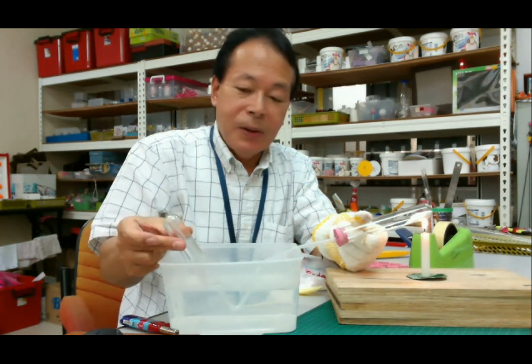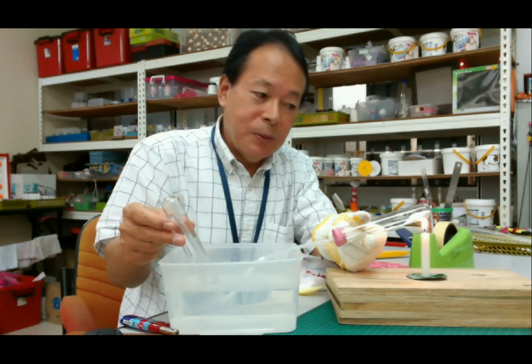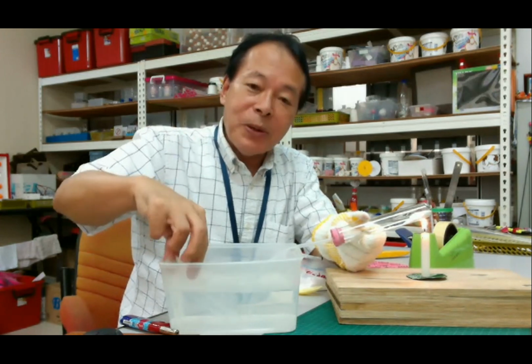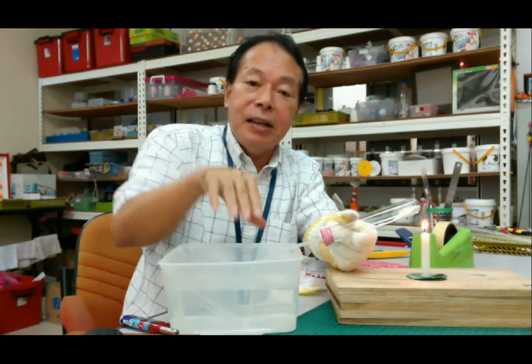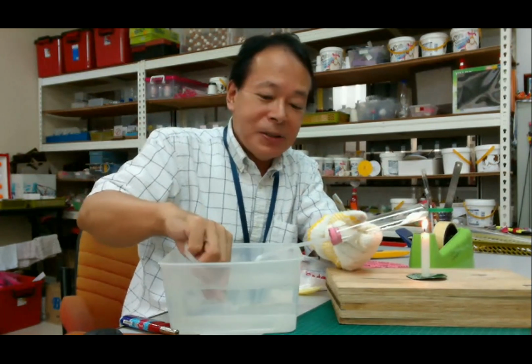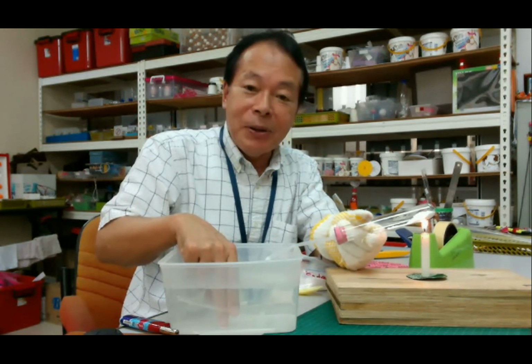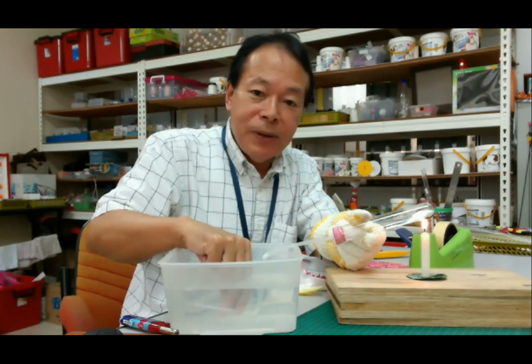Okay, so can you see the bubble is coming? So the water level is going back. Okay, before that, inside the test tube in advance, there's some air. So we have to push the air outside. Before collecting the carbon dioxide, first we have to remove the air to the outside. So we have to wait before collecting the carbon dioxide. Okay, you can see the bubble. Okay, so many bubbles are coming out now. Then wait a little moment.